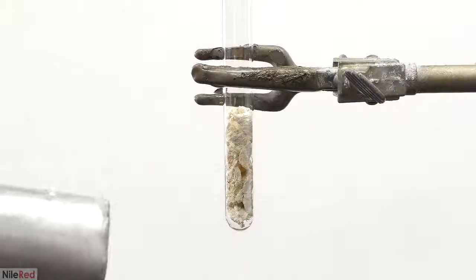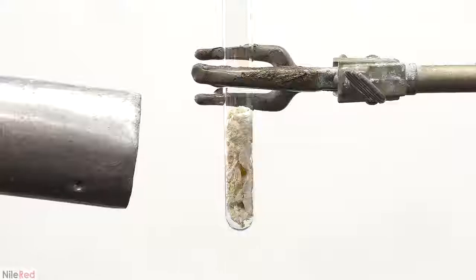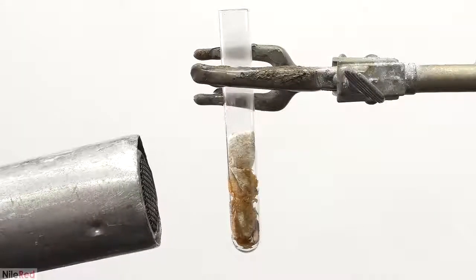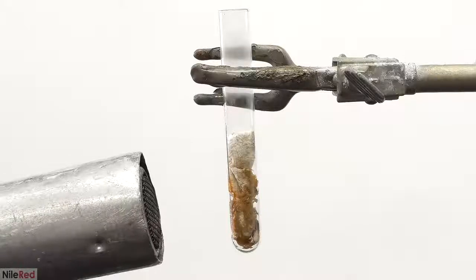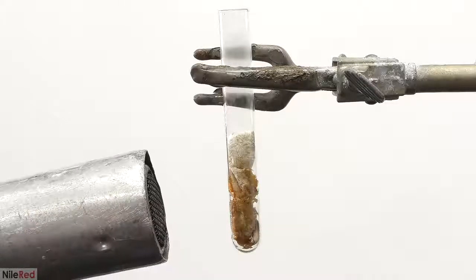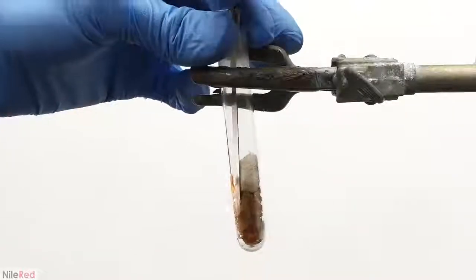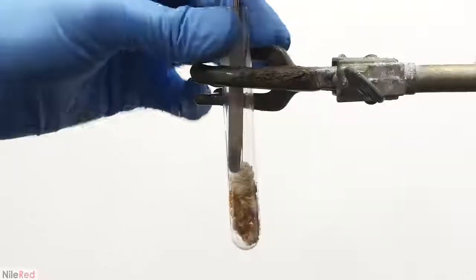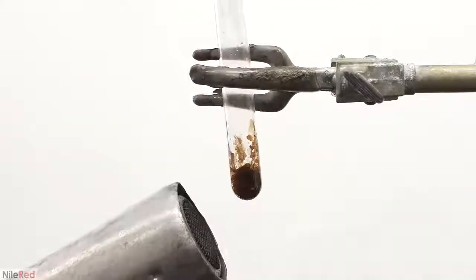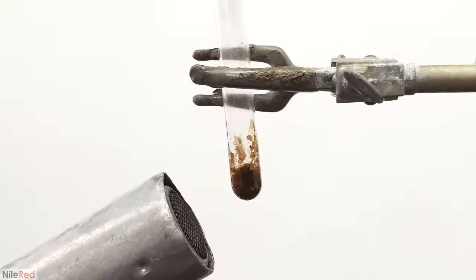I started blasting it with a heat gun, and the goal now is to completely melt it. The melting point of nylon is around 265 C, so this is going to take a lot of effort. It's also possible to use a Bunsen burner or a blowtorch, but I really didn't want to burn things. I occasionally had to stop and shove everything down to the bottom using a metal spatula. Once I got to the last little bit, I continued heating it until it completely liquefied.